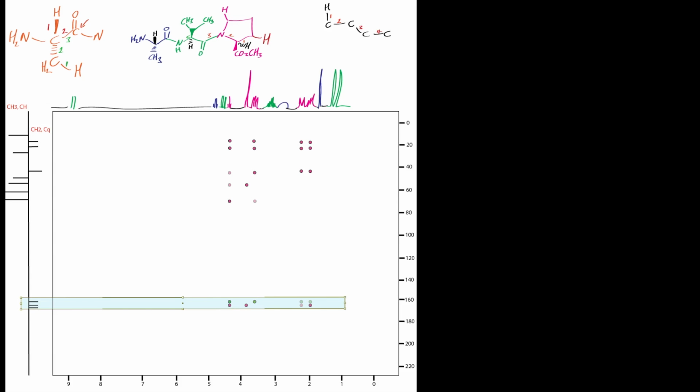Now if you looked at the total spectrum, I'll just turn that off, you'll see that it's actually a bit more complicated than meets the eye. And also, if you actually did a HMBC, the resolution of the carbonyls is not that great. Okay, so you'll probably be seeing, if I draw this in red, these carbonyls here would be all overlapping like this. Okay, you'd have really poor resolution. You might not even see them. Okay, so it'd look a bit like that.